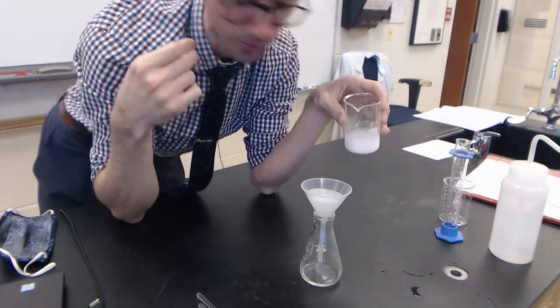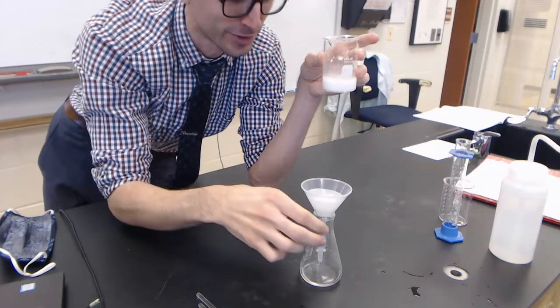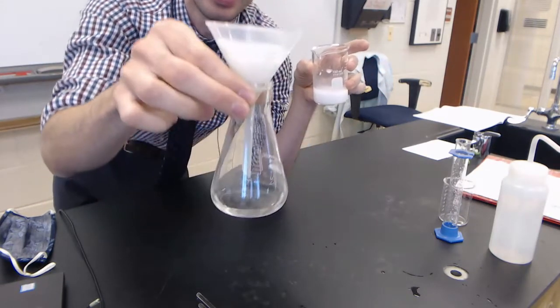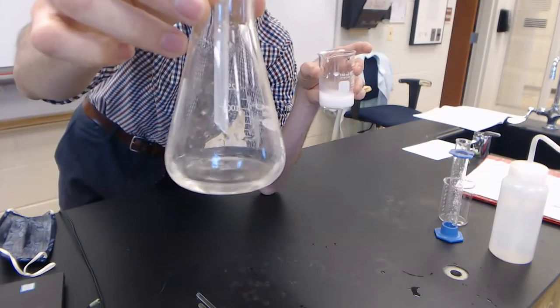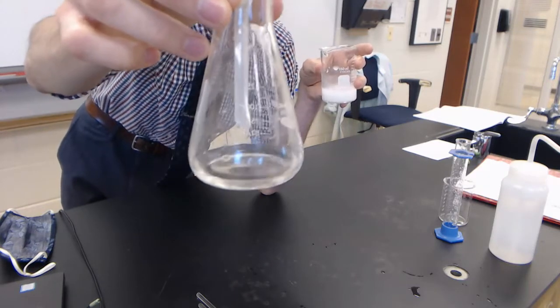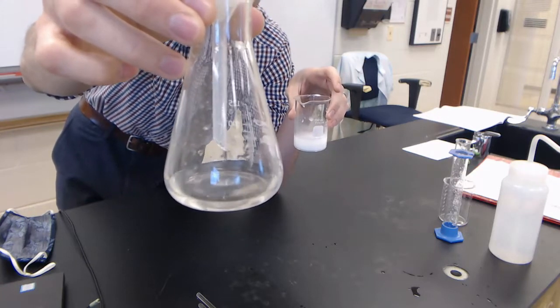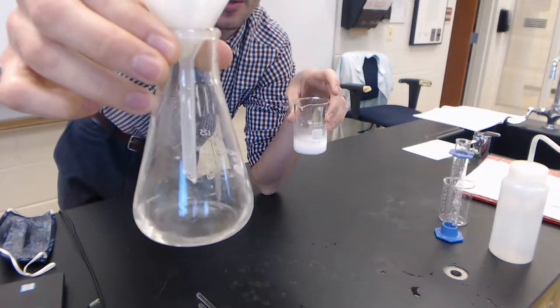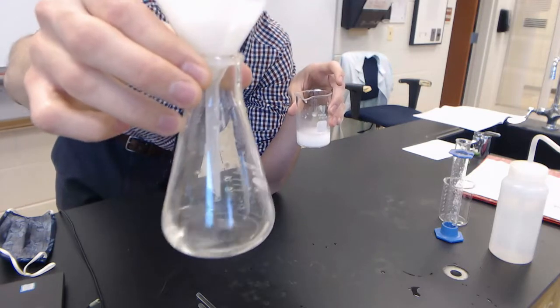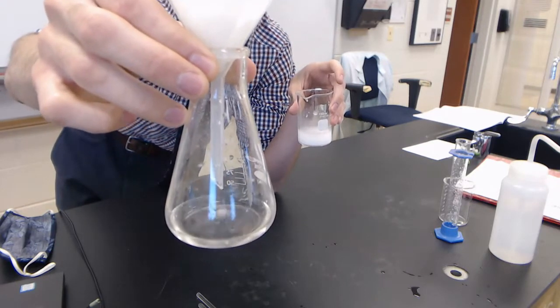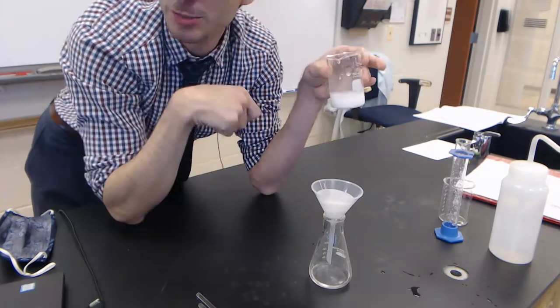The slower you go the better, but students don't want to be in here for three hours filtering some white precipitate. I don't want you taking an hour to just mix the two solutions. You have to be quick and efficient, so being fast is good but not just fast and messy—fast and efficient. You eventually become better with time with perfect practice.